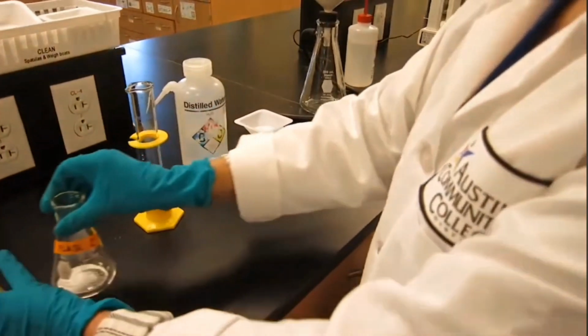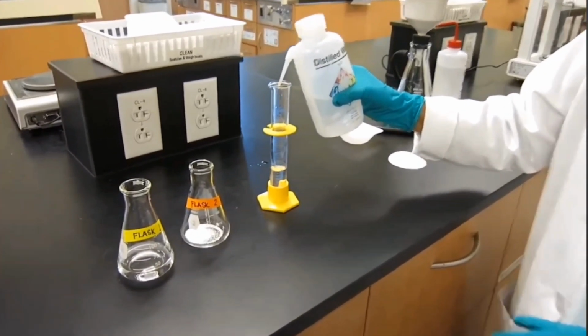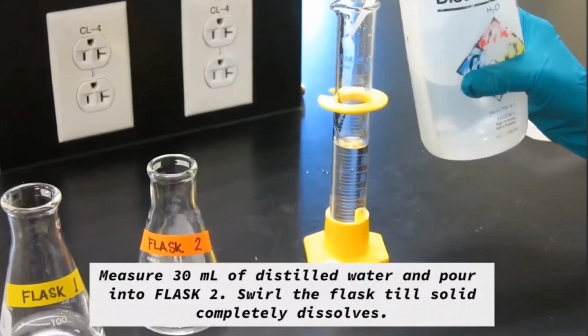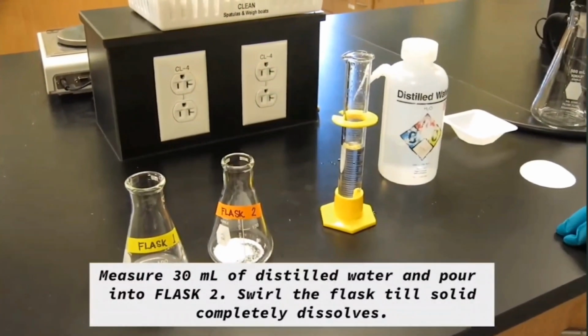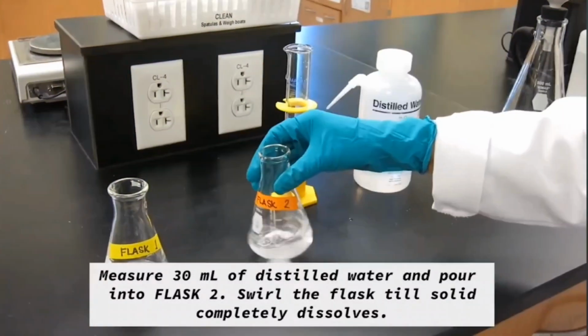Now you know what needs to be done. So another 30 milliliters of distilled water into the graduated cylinder, and you're going to pour that into flask number 2. So we are going to make an aqueous solution of sodium carbonate.